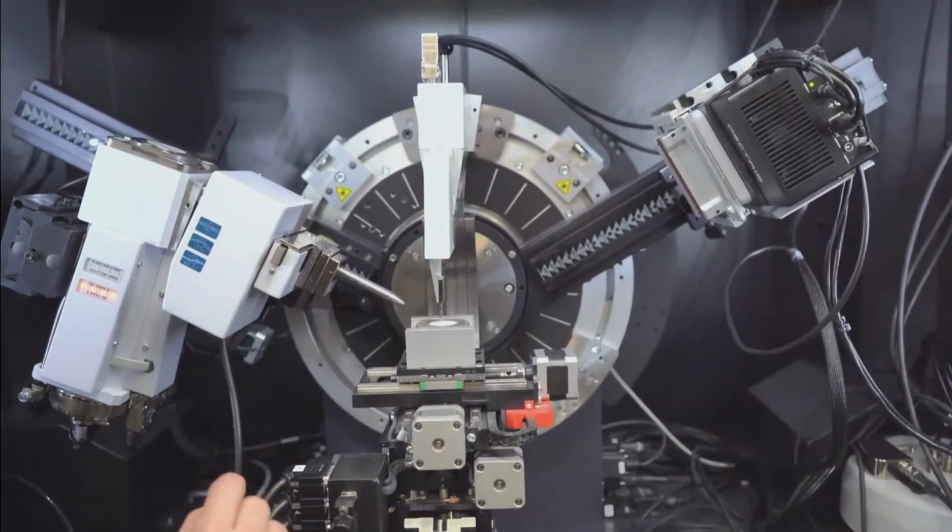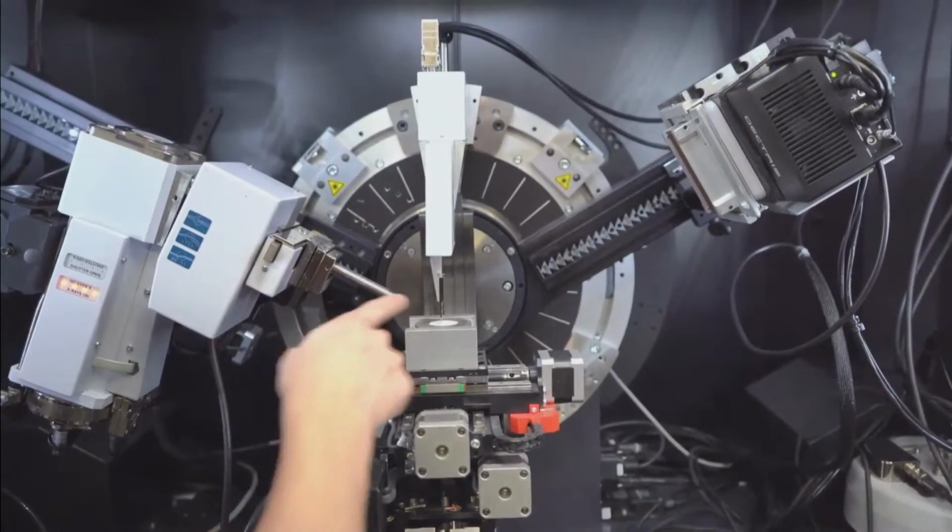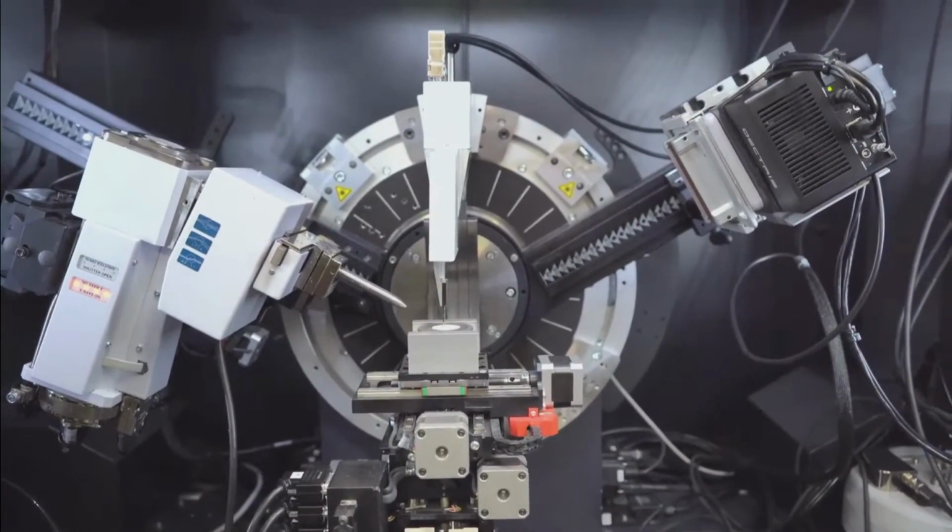Okay. Yeah, and that's important for getting those nice sharp Debye rings. Exactly. So I'm going to have a 1 millimeter spot here, 1 millimeter spot here, which means on my sample it'll be about 1 millimeter. Okay. So what do we got to do here on the detector?